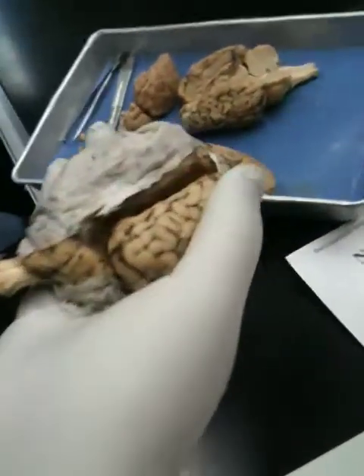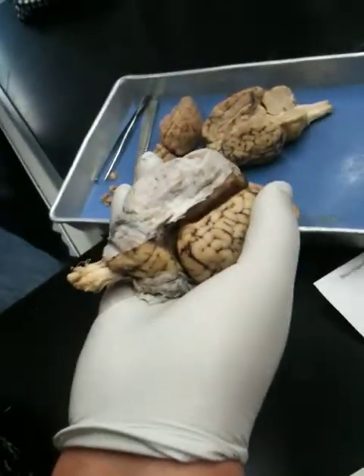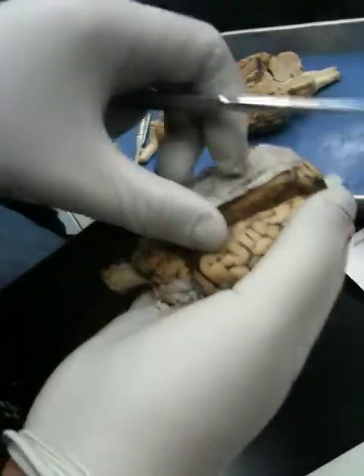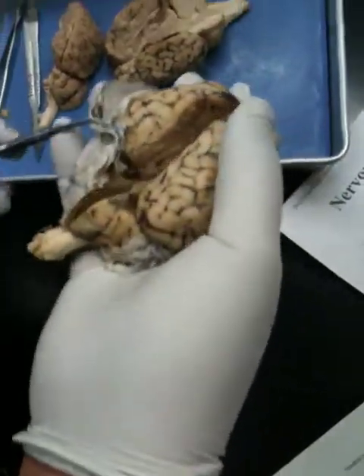We just did it, but I don't understand it. So it's composed of simple squamous epithelium. It's what insulates your brain and nourishes it. What's it called again? The connective tissue. This is the dura mater. And this is underneath — you see the arachnoid mater, and you can see the trabeculae. Remember we talked about the arachnoid trabeculae?